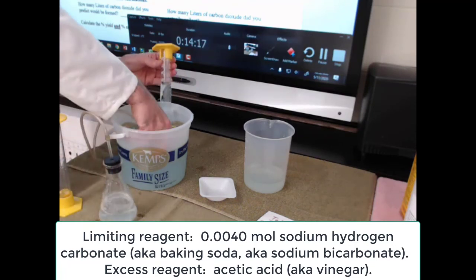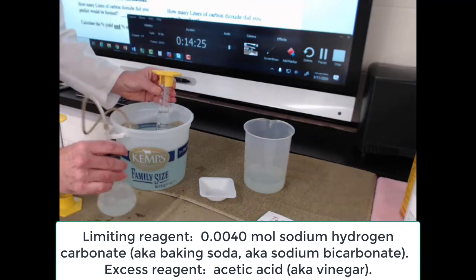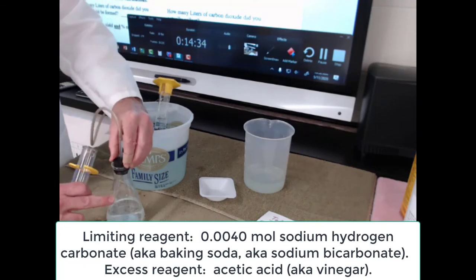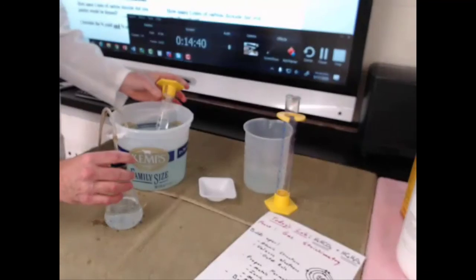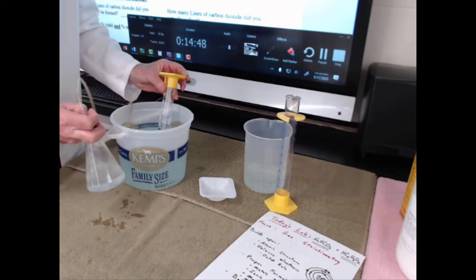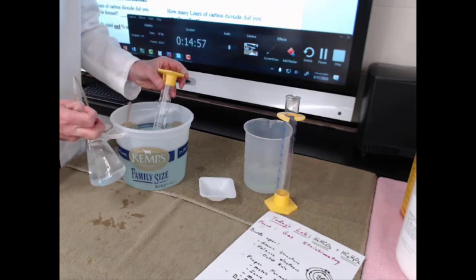Or, oh no, that wasn't bad. All right, I lost a couple bubbles right there, doggone it. Okay, so is it still going? We're at about 50 milliliters right now, so I guess I did run out of acetic acid, and so I will add a little bit more to make sure that that's not the limiting reagent, because the only thing that I know for sure is the grams of baking soda, sodium hydrogen carbonate, also known as sodium bicarbonate. And the bubbles are still coming up, but it's going pretty slowly. We're running out of something. We've got a limiting reagent that's pooping out in there.